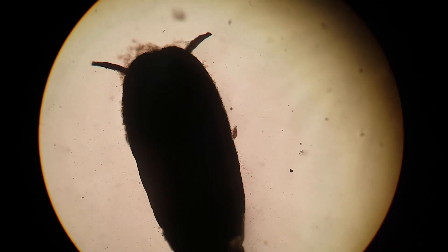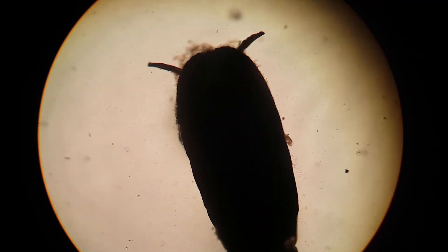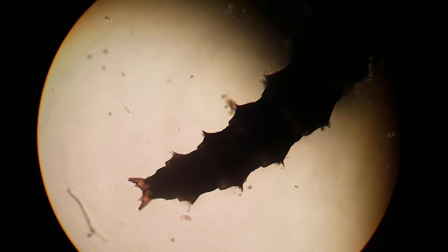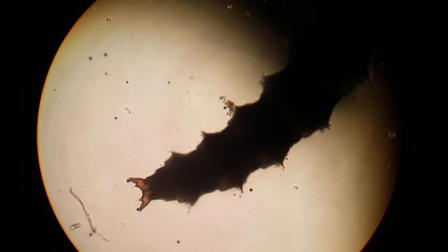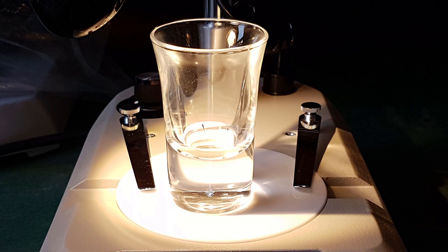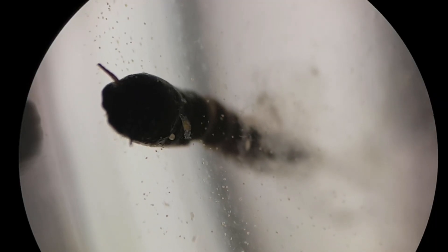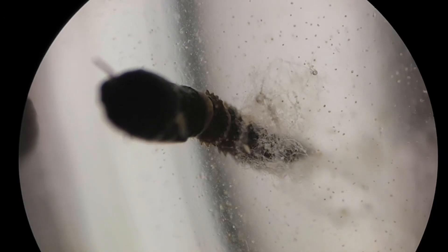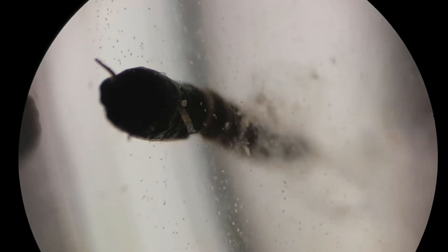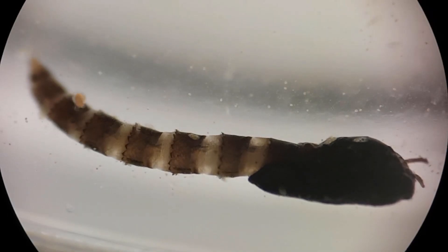And now let's take a closer look at some of those larvae and pupae. Here we have a pupa, and what I found interesting about this shot is that you can see a lot of microbes using this pupa's body as a structure to hold onto. This is, by the way, the only proper use for a shot glass. Here you can see again that these pupae are living in a sort of microbe soup that is simply not apparent when looking with the naked eye.